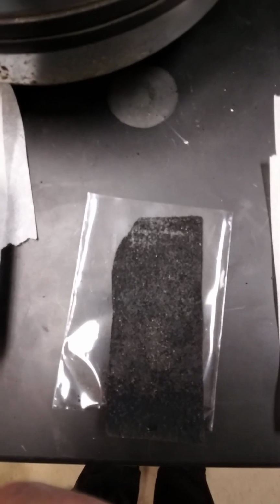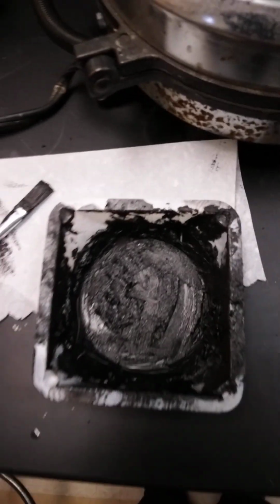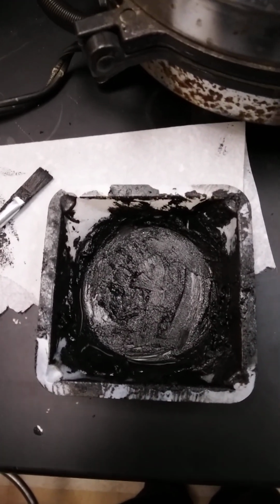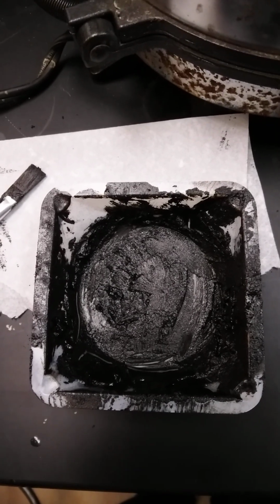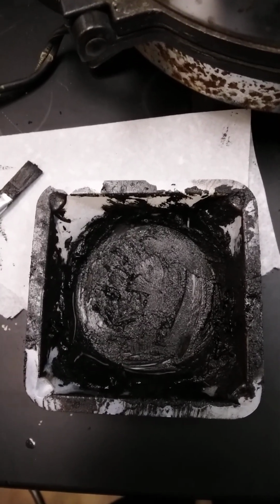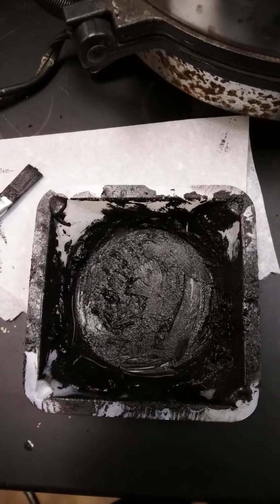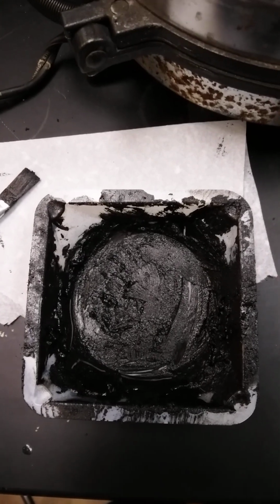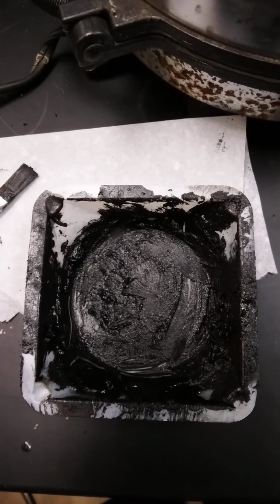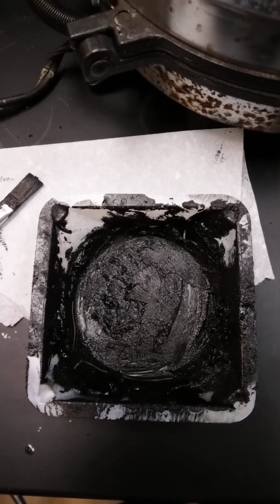That one has too much on the surface. There is too much resistance. But typical paste, carbon black, graphite. We have included halloysite nanotubular clay, a small amount of extra fine activated carbon, and there's a trade-off between desired conductivity and porosity. And this is where we're at right now.